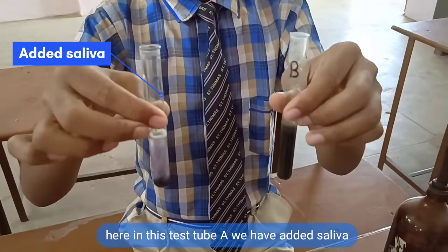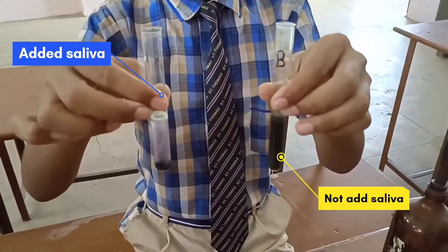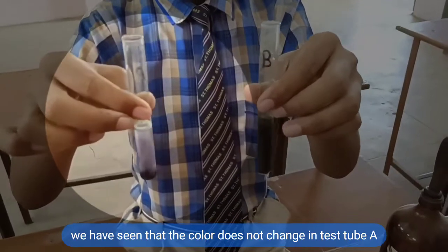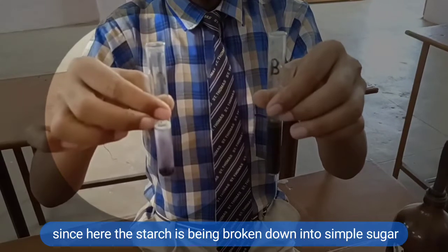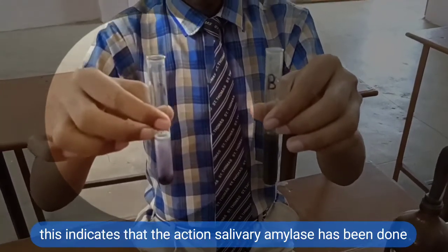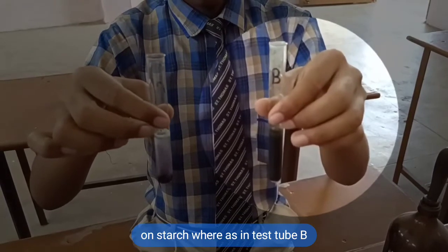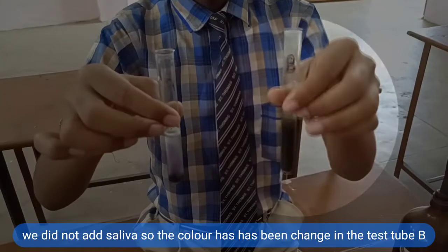In test tube A, we have added saliva, whereas in test tube B, we did not add saliva. After adding iodine solution in both the test tubes, we have seen that the color does not change in test tube A, since here the starch is being broken down into simple sugar. This indicates that the action of salivary amylase has been done on starch, whereas in test tube B, we did not add saliva, so the color has been changed in test tube B.